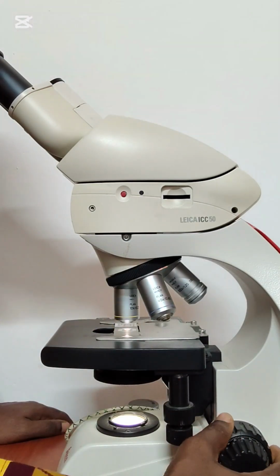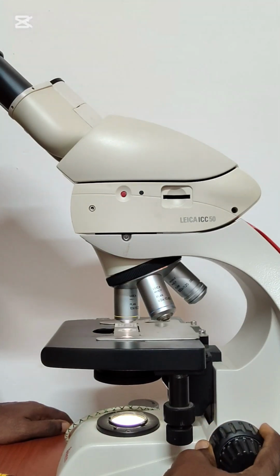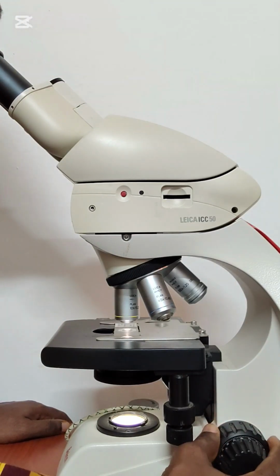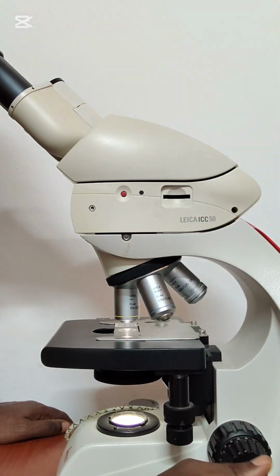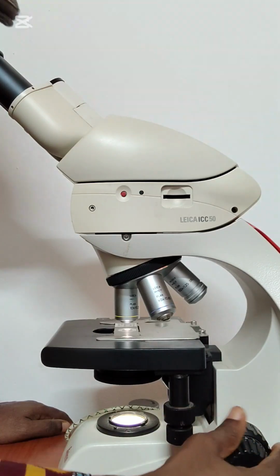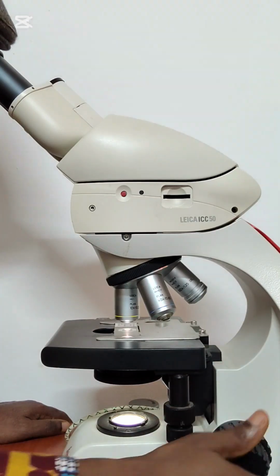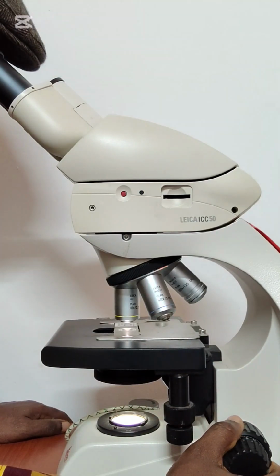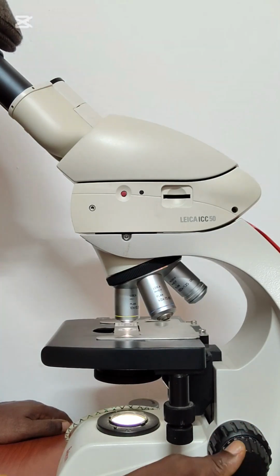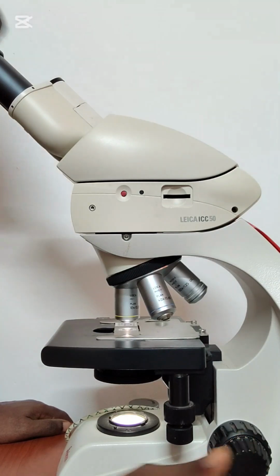So if you are turning the coarse adjustment, which goes up with clockwise and down with anti-clockwise, you have to be careful. Ideally you go anti-clockwise from the last setting you used with the ×4. You just go backwards, that is anti-clockwise, and then it will refocus. But because I have turned it anti-clockwise many times, I will have to move clockwise again to get a little focus. Yes, I get a focus here, I leave it, and then I use the fine adjustment knob to fine tune it. Okay, good.